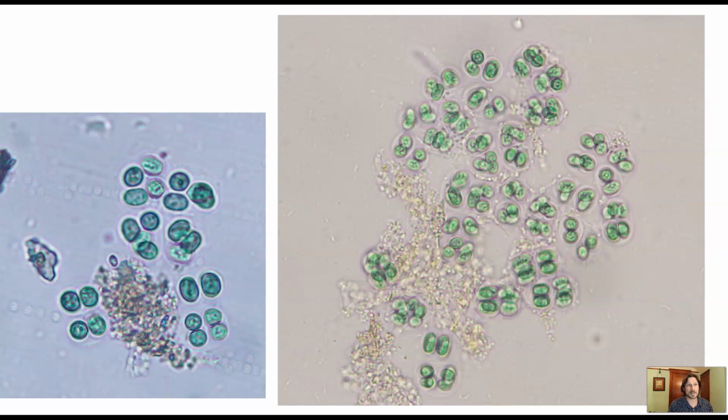In the plant cell you had one large cell with little green discs on the inside, but the cyanobacteria do not have chloroplasts. The whole cell membrane is doing photosynthesis. So the whole cell is green. There isn't a subset of the cell doing photosynthesis. The whole cell is doing photosynthesis. So this is our Gleocapsa, right? Very different looking from Anabaena. You won't mix it up with that at all.